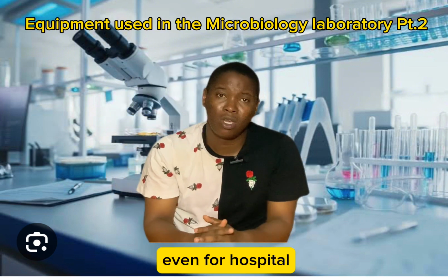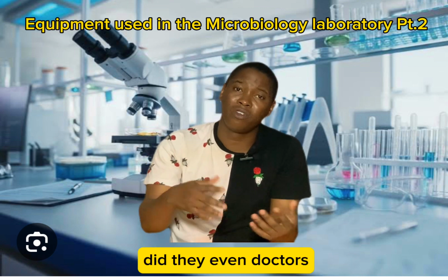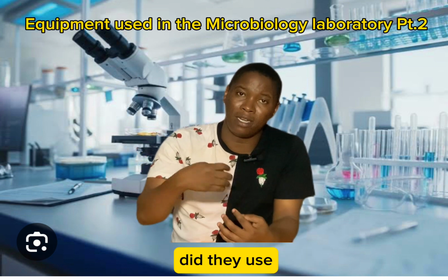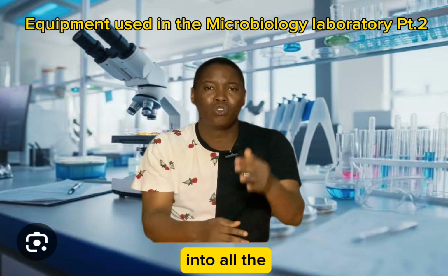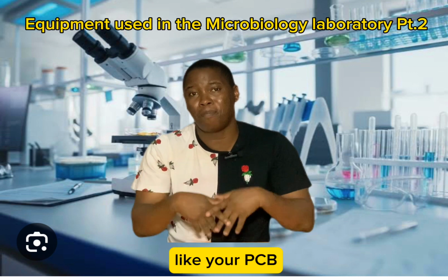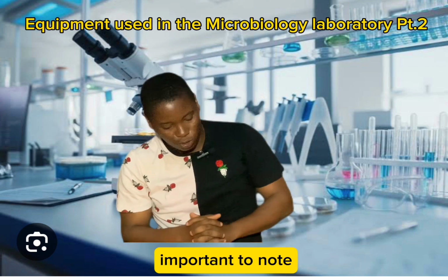Even for hospital, e get our brothers wey be scientists, wey be medical laboratory scientists, even doctors, they dey use wetin we dey call hematocrit centrifuge, and that one they dey use blood samples on top am. E go separate those blood samples into all the component parts wey dey for inside the blood, and they go fit tell you different values like your PCV and other important information. So this one dey important to note.